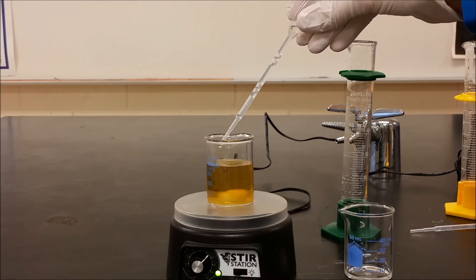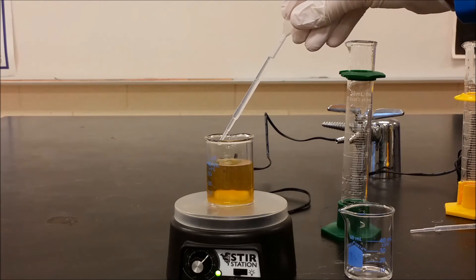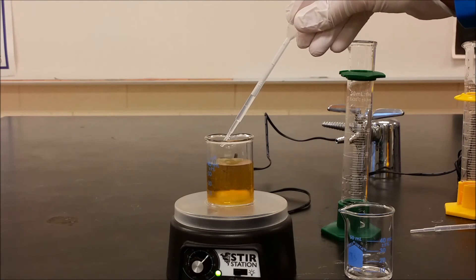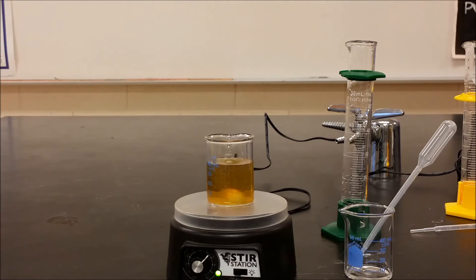We're seeing our yellow color persist, and that's an interesting historical note — when they used silver in stained glass windows in the past, that's where the yellow color came from. Yellow and red are the two most expensive stained glass forms because it's silver and gold. What we're doing is really simple: we're taking silver ions and forming silver atoms, but with this specific procedure they form tiny clumps we call nanoparticles — maybe 10,000 to 100,000 silver atoms in one clump. Because of that small size, they bridge the gap between the quantum world and the macro world, where we don't have bulk metal but also don't have singular atoms, giving them unusual properties in how they interact with light and act as catalysts.